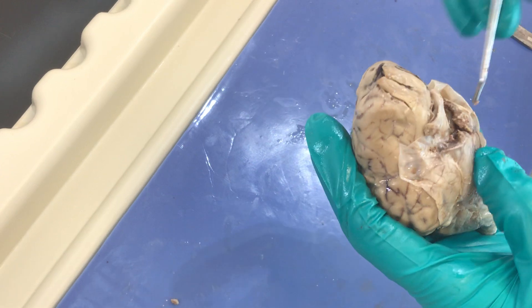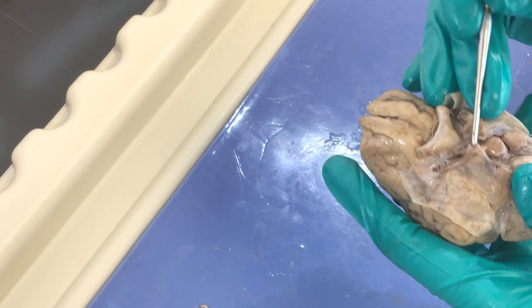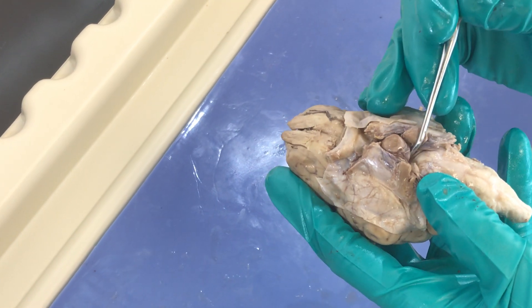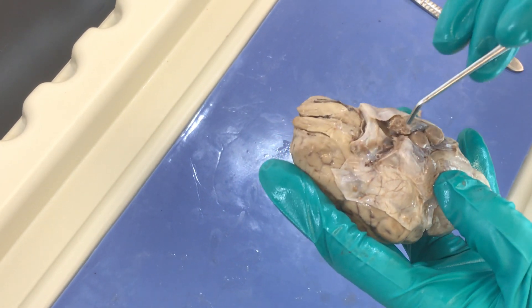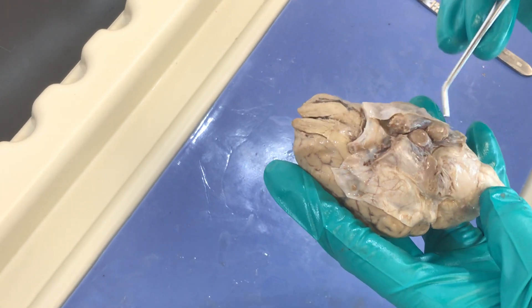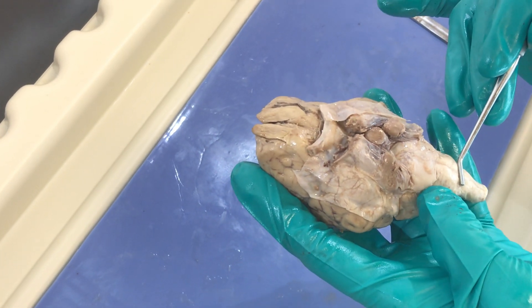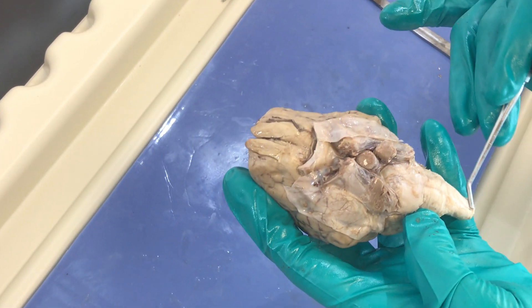There are some hard parts here that are actually going to be bone, and then we've got the pituitary that's kind of sitting and dangling from this tissue here. Right above that will be our hypothalamus, and then as we extend caudally we've got the pons, then the medulla, and then our spinal cord.